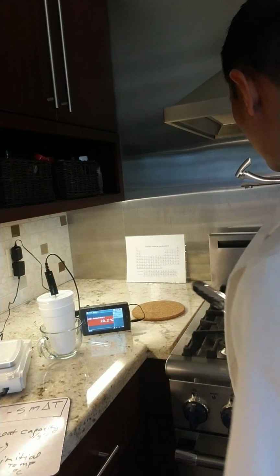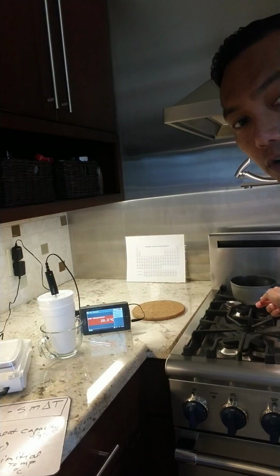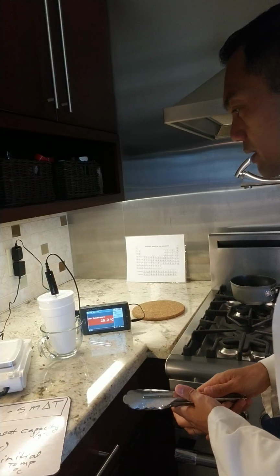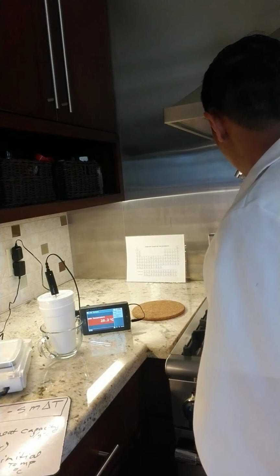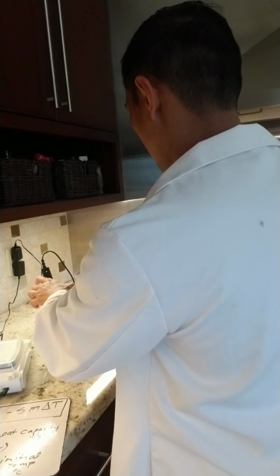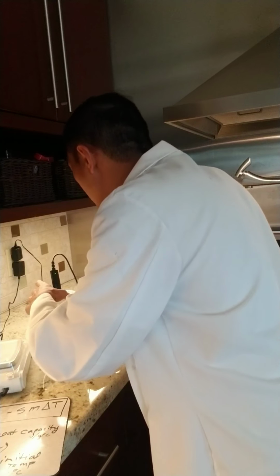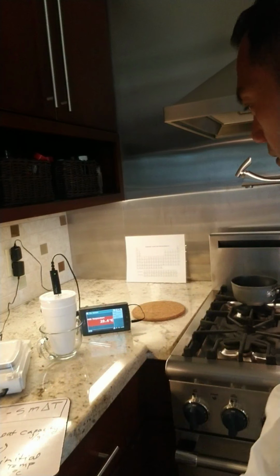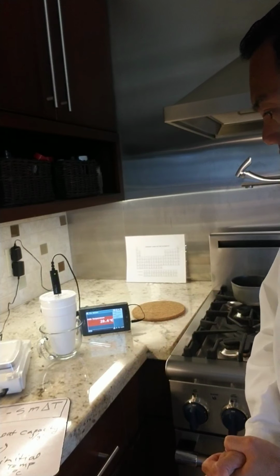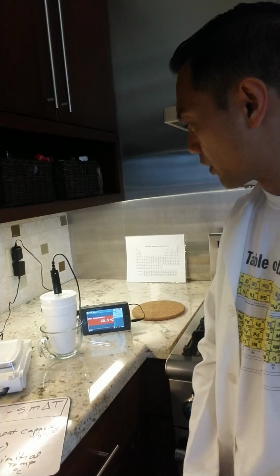Turn off this fire. So again, 20.2 is the initial temperature of the water. The initial temperature of metal B will be 100 degrees Celsius because it's been sitting there for quite some time. So now metal B. All right, let's drop metal B, it's in there. So let's see what the temperature change is, you give it some time. Starting to increase, now it's 20.5.